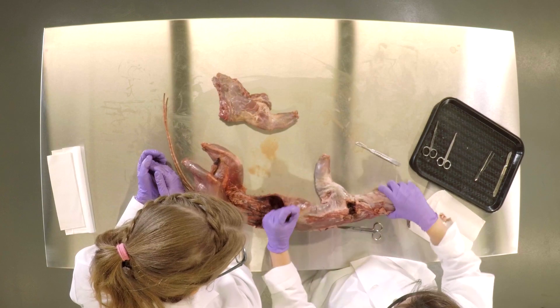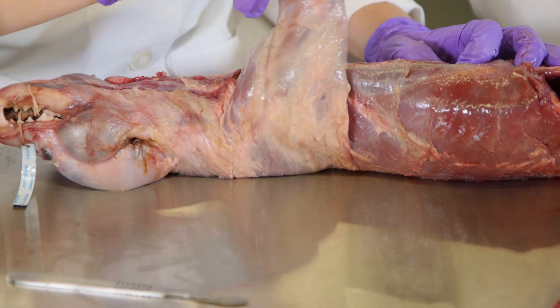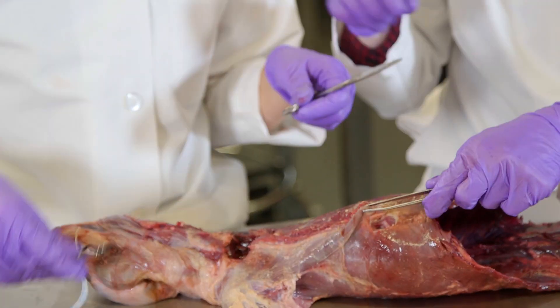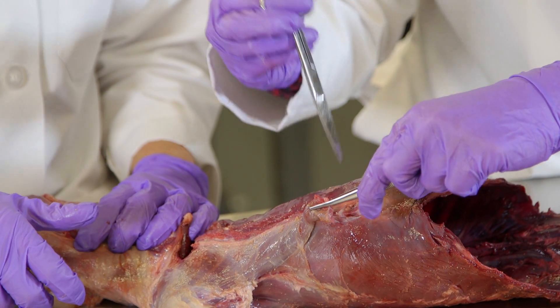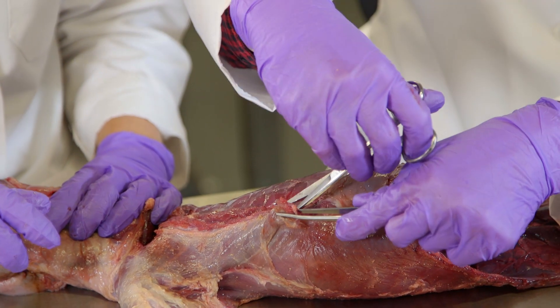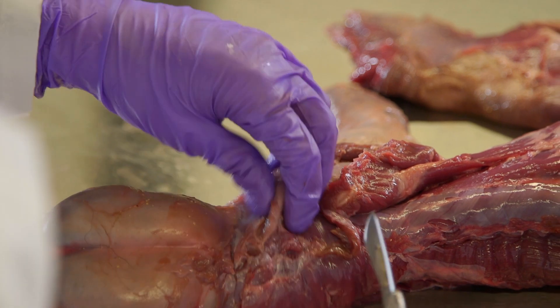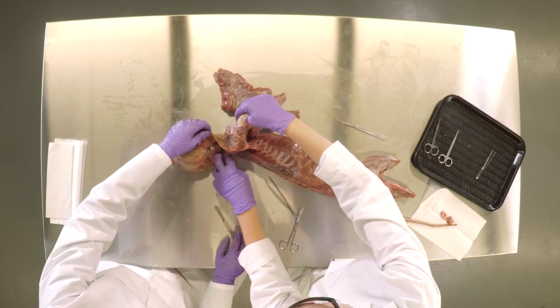We're going to work on the other limb now. This is the pec muscle, which sort of flexes the arm — what you're going to do is detach it from the trunk. Start with the scalpel and then when it starts coming loose, get in there with the scissors — pull it towards you, get some tension, and spread apart to feel how the tissues just spread along their natural plane, and then where there's a connection you just snip. That's where the muscle is actually inserting onto the ribs, so we have to cut that. This guy has an obscenely thick neck — he was probably a really muscly male that you wouldn't want to mess with.